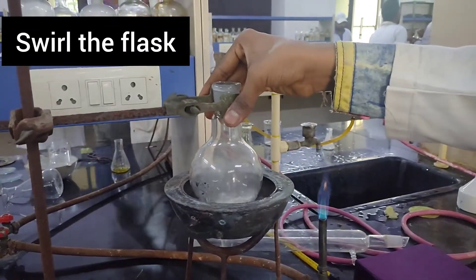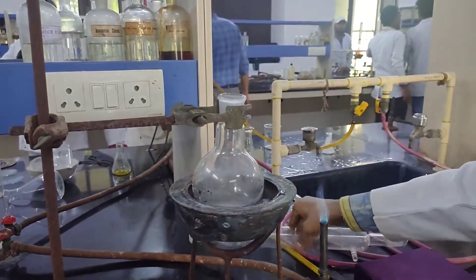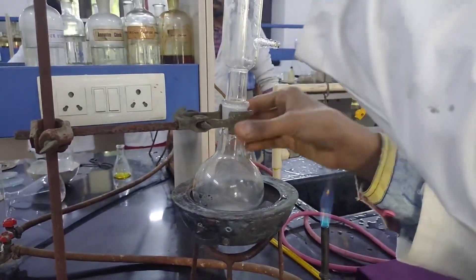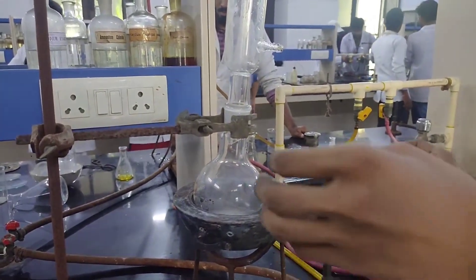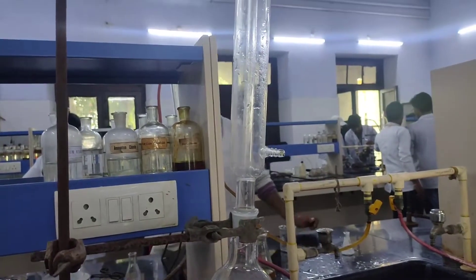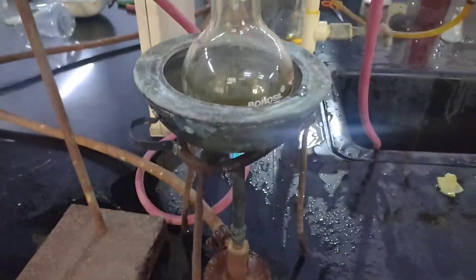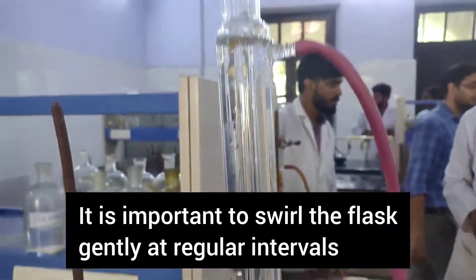The flask is swirled to shake and mix the contents gently. Then the condenser was placed on top and the water pipes were connected. Then the flask was heated on a water bath for 80 to 90 minutes. It is important to swirl the flask gently at regular intervals.